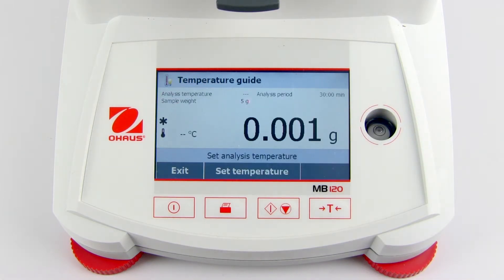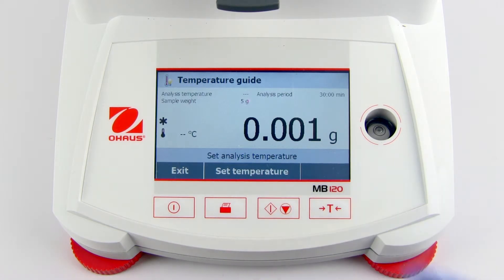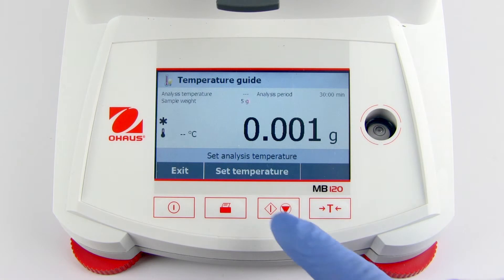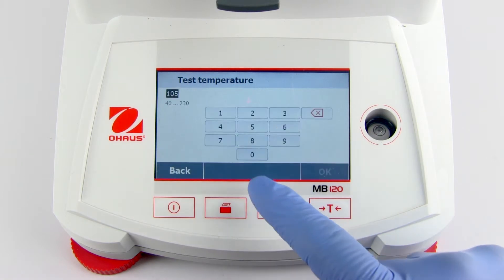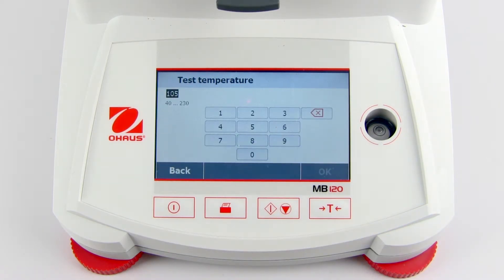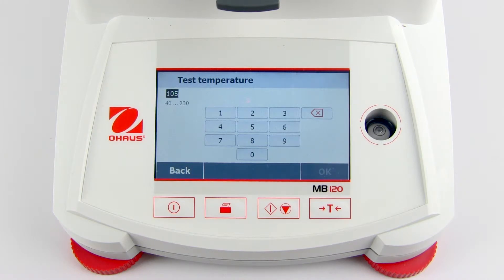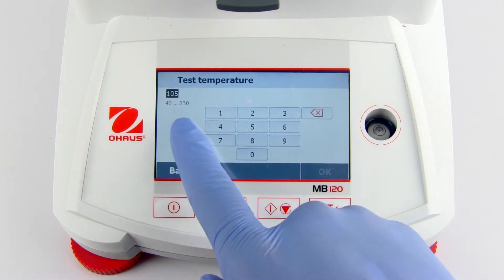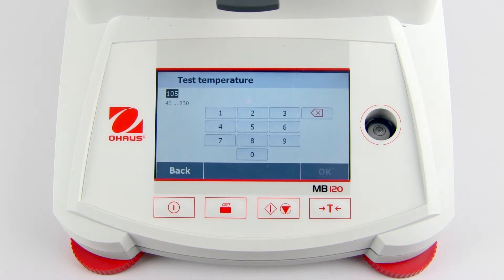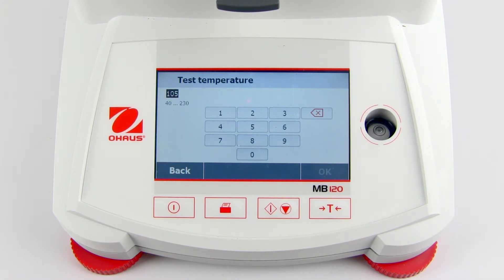First, the analysis temperature must be set. The test temperature should be higher than a reasonable drying temperature for your sample. In many cases, this can be the maximum device temperature of 230 degrees Celsius. However, if there is a risk of flammability, smoking, or damage to the device, select a lower temperature.